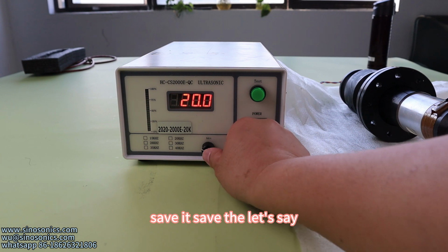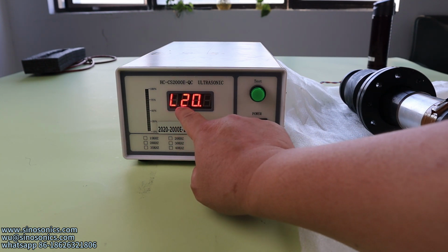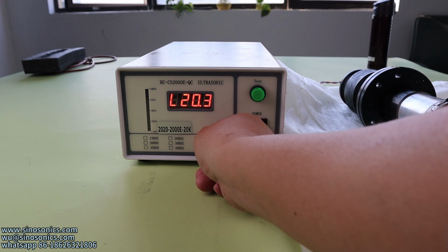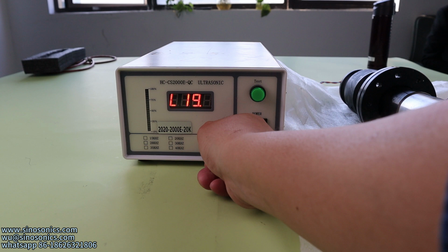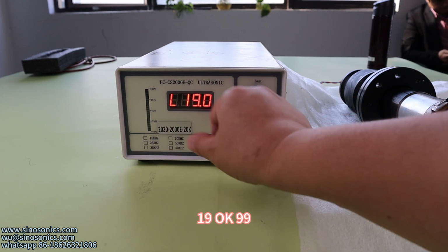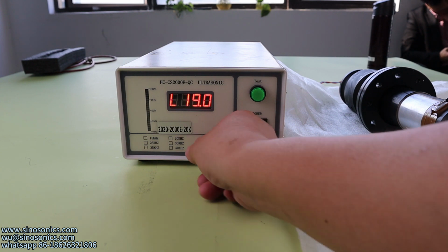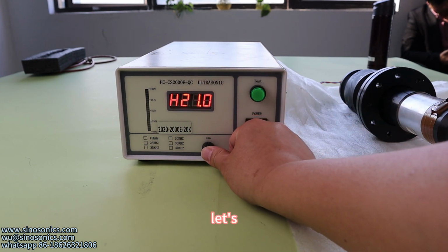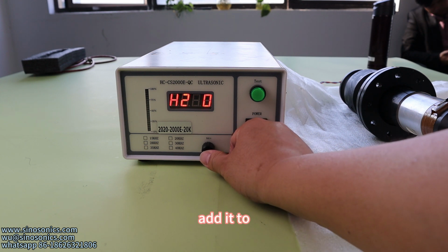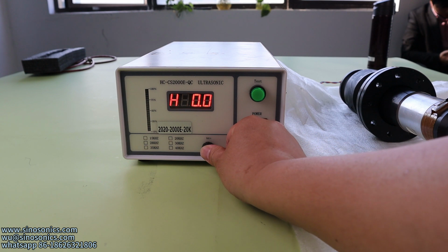Let's say we save the start frequency here. Let's set it to 19. Okay, 19. Let's say H. Let's edit it to 20.